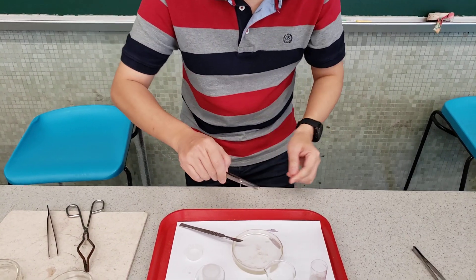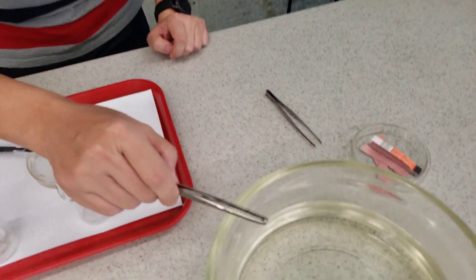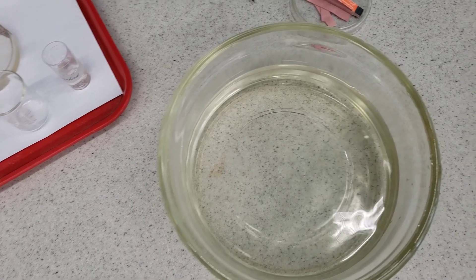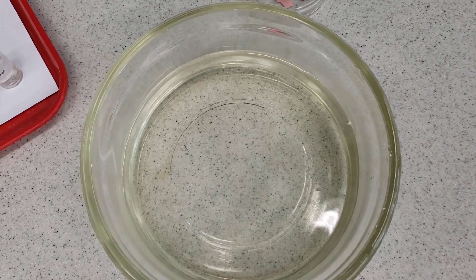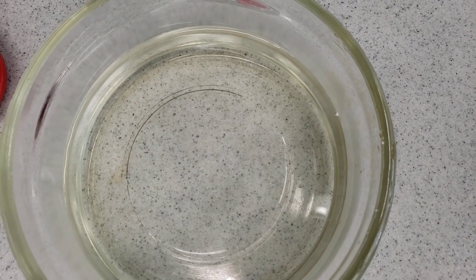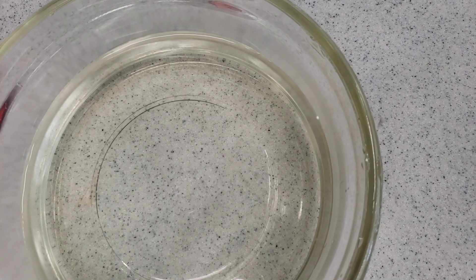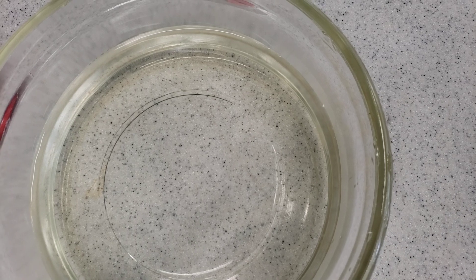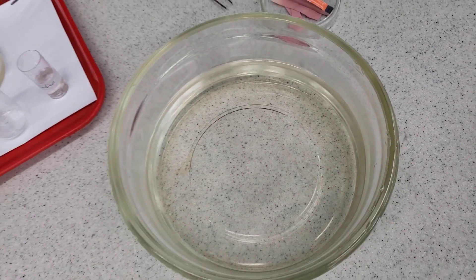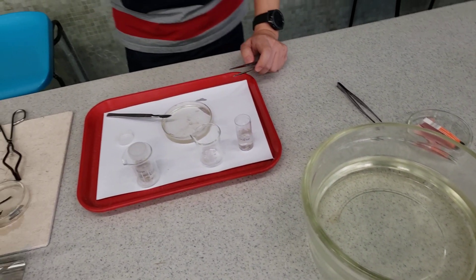Next I will add the sodium into a trough of water. Let's see what will happen. Can you hear the hissing sound? Can you see the sodium keeps moving? So the reaction is quite vigorous. Sodium is a reactive metal.